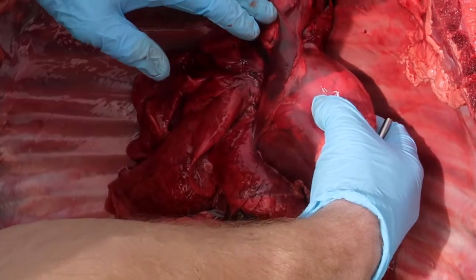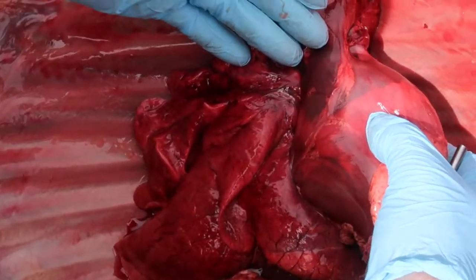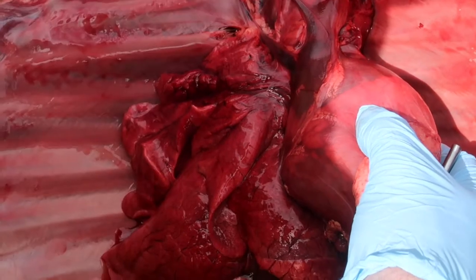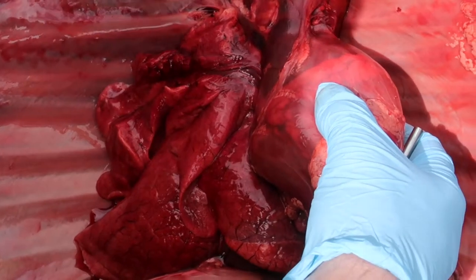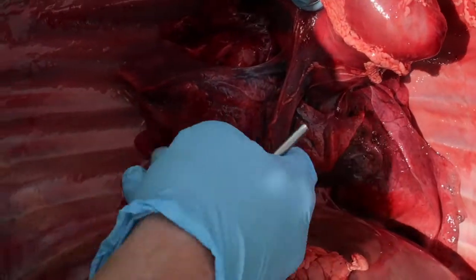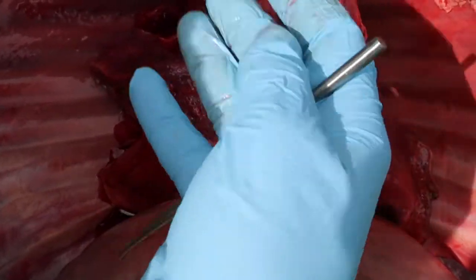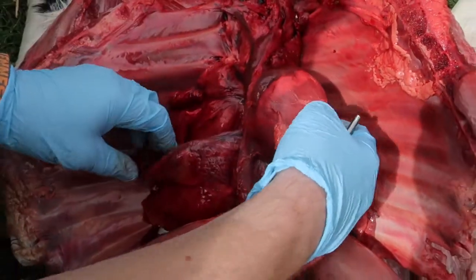What we have here is the cranial vena cava, which is bringing blood back to the heart from the cranial part of the animal, the top part of the animal, the head and the upper limbs. And this is deoxygenated blood coming back to the heart to then be pumped to the lungs. Down here and below we have what's called the caudal vena cava coming from the lower half of the animal, also coming back to that right side of the heart to then be pumped to the lungs to be re-oxygenated to then go back to the tissues.